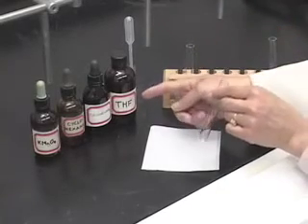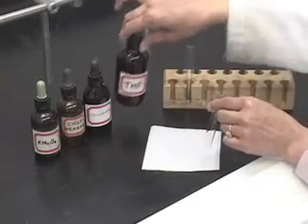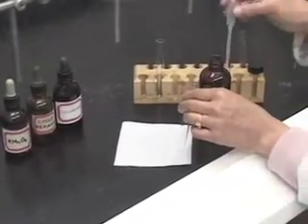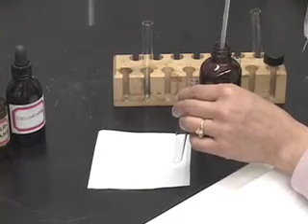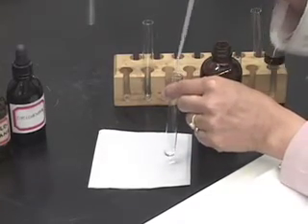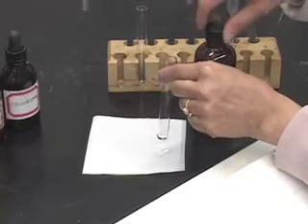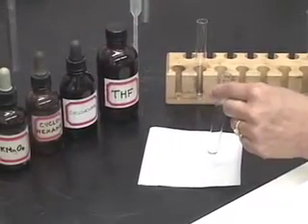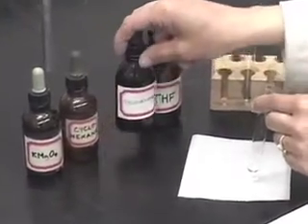You want to take 0.5 milliliter of THF, tetrahydrofuran. Use the Pasteur pipette attached and take 0.5 milliliter of THF in a test tube. And to this you want to add two drops of the compound that you want to test.